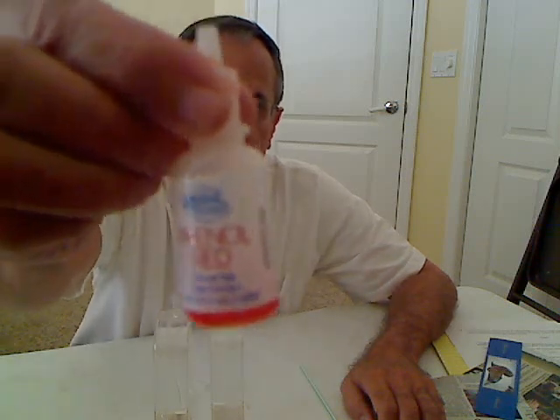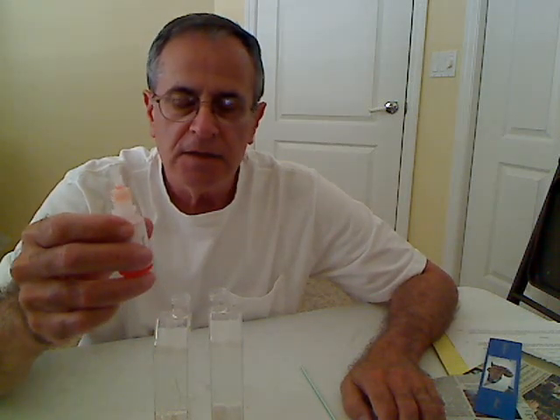so I developed another demonstration of the same thing using phenol red, an indicator that turns from a pinkish color to a yellow-orange color when the solution goes from slightly basic to slightly acidic. It's used in pool testing, and you can get it at any pool supply store or Walmart or a place like that.